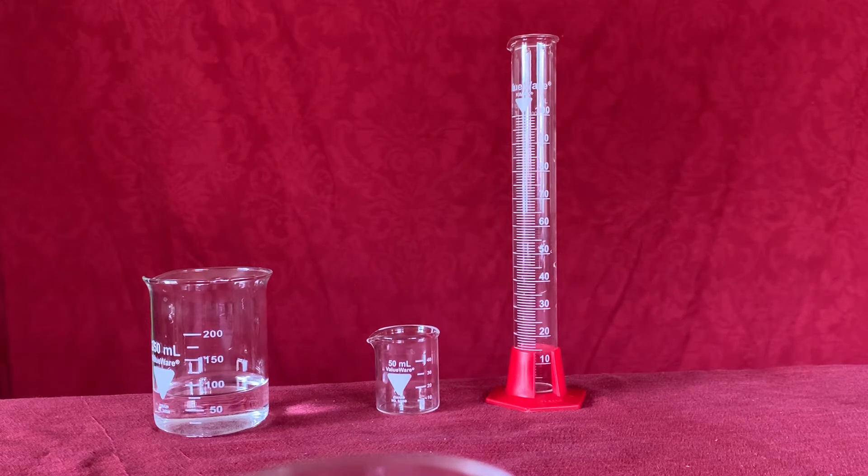In this video we're going to compare measuring volume in a beaker to measuring volume in a graduated cylinder.